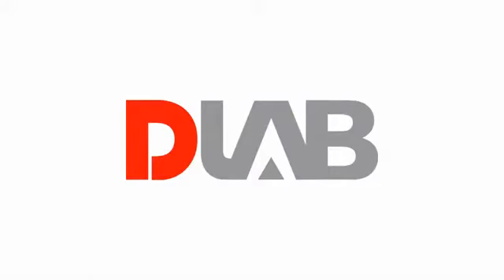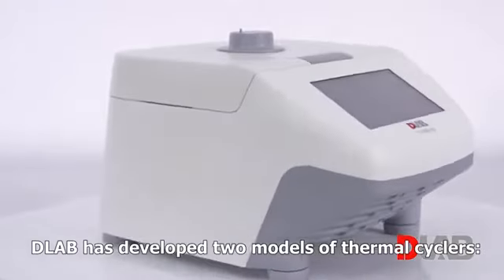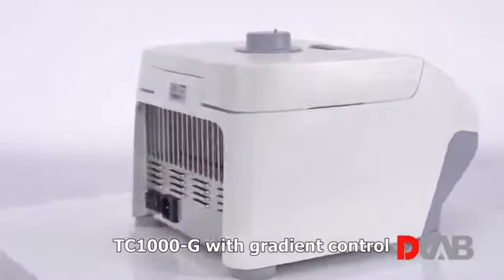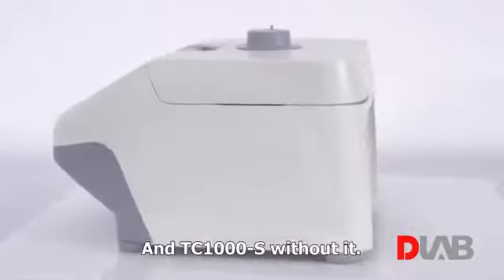PCR Thermal Cycler. D-Lab has developed two models of thermal cyclers, TC1000G with gradient control and TC1000S without it.